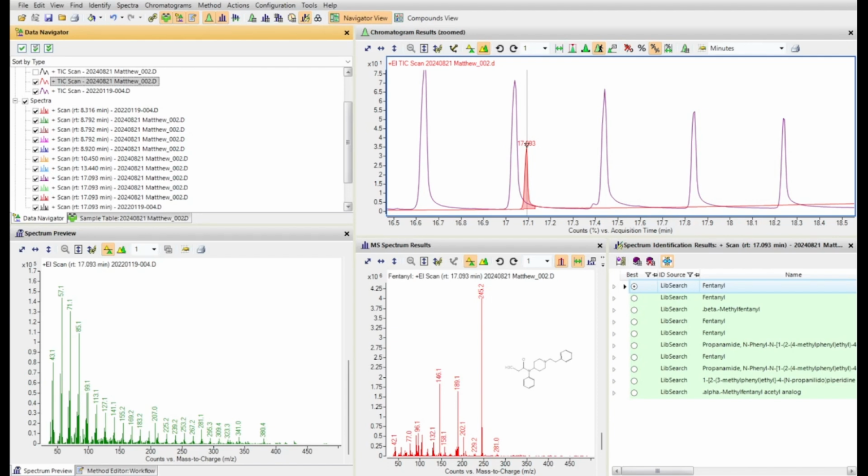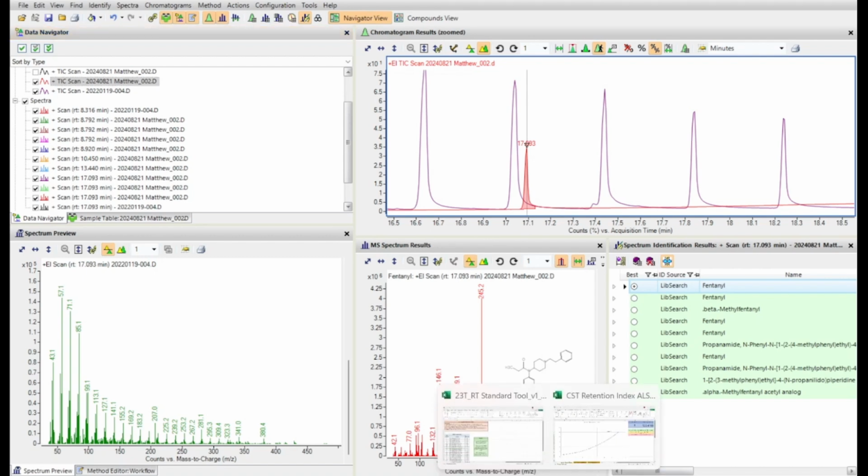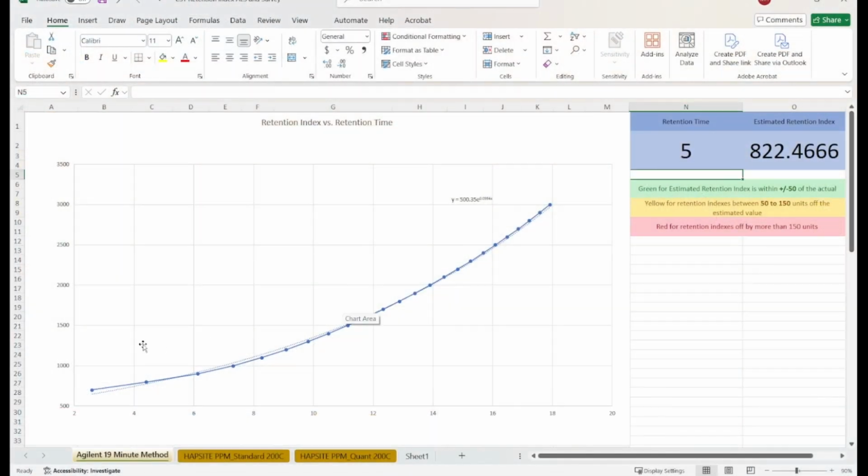While overlaying a retention index standard can be useful, I've also built a tool to estimate retention indexes based on retention time. So with a retention time of 17.1, using my Excel spreadsheet, I've plotted all of my different retention indexes versus their specific retention times. I have a line of best fit going through that curve, and then I've used that line of best fit to estimate retention indexes up here in the top right.